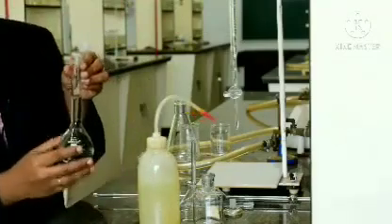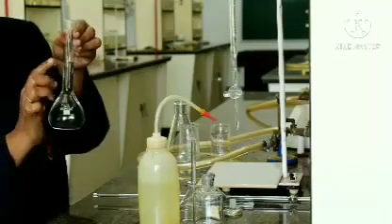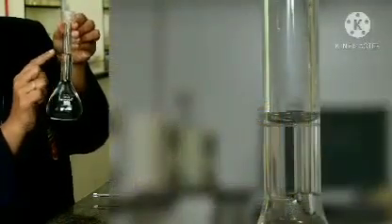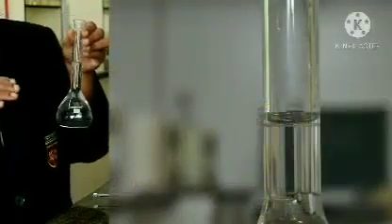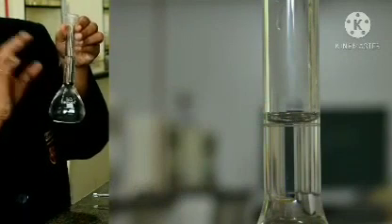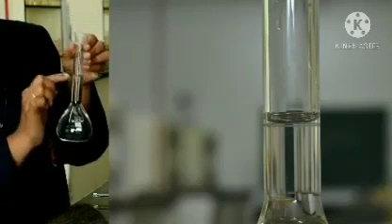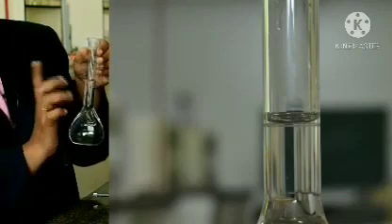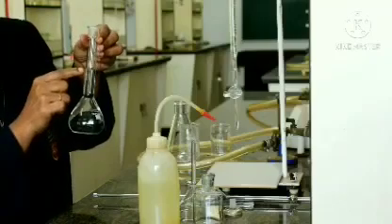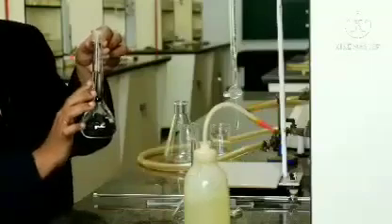Whenever you are having a colorless solution like this, when you are taking the mark, the reading, see that the lower meniscus touches the line. When you see the water surface, it has got an upper meniscus and a lower meniscus. Whenever you are taking any volumetric analysis, when you are using a colorless solution, you have to take the lower meniscus. So, that is the curved part. The bottom part should touch the mark. Now, we have transferred and we have made up to 100 ml.